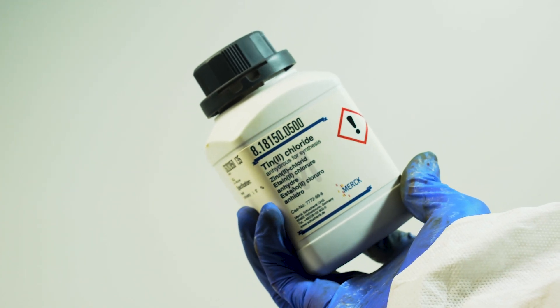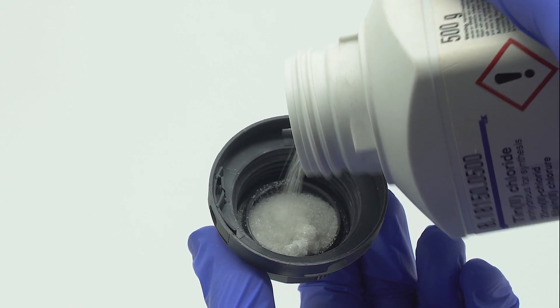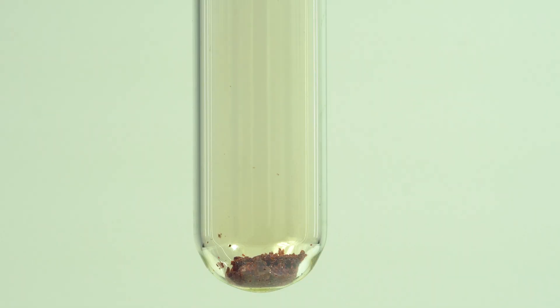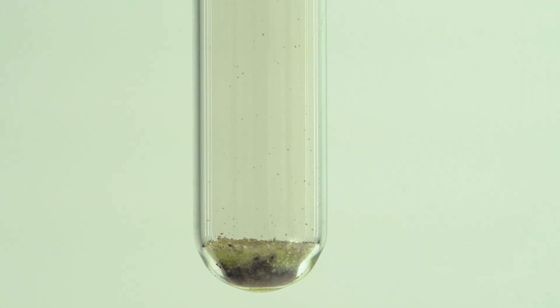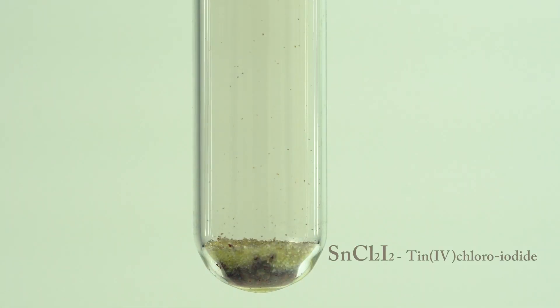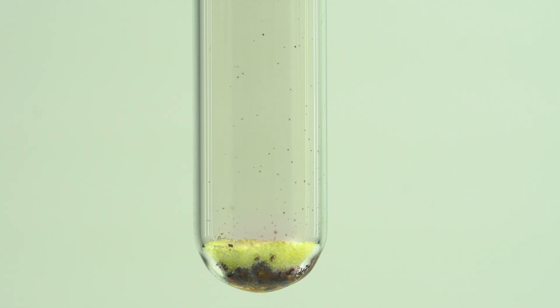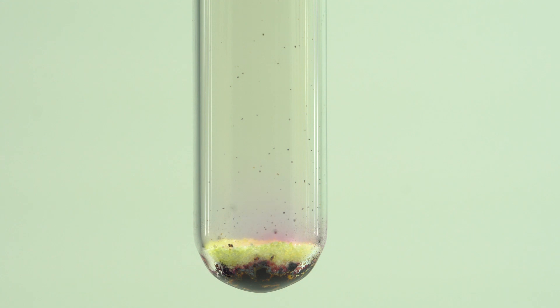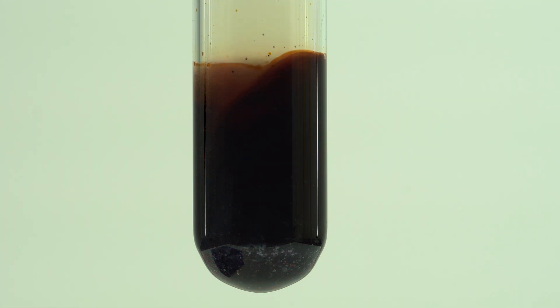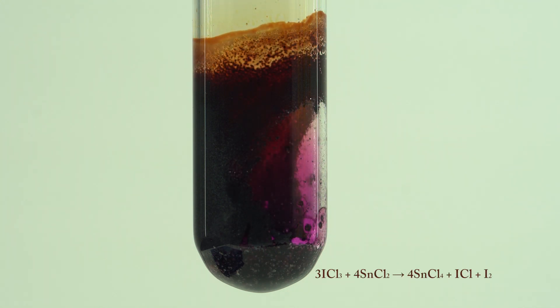Now I will show you a very interesting reaction with tin(II) chloride. Keep in mind that it must be anhydrous. This is very important. Tin(II) chloride is colorless crystals with strong reducing properties. Now I will add it to iodine trichloride. Notice how quickly tin chloride crystals turned yellow — it's tin chloroiodide that gives this cream color. The main reaction leads to the formation of tin tetrachloride, iodine monochloride, and elemental iodine.